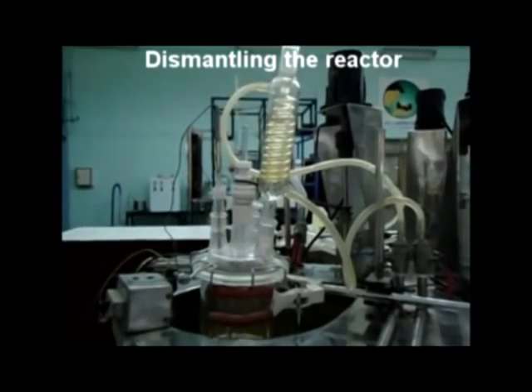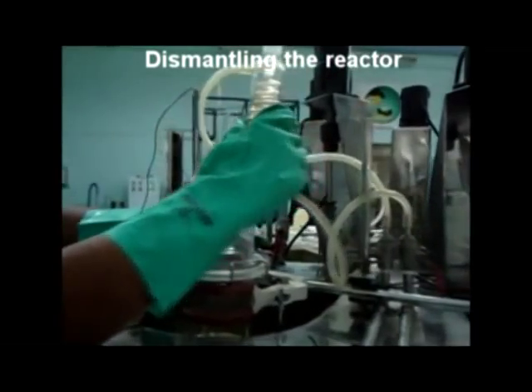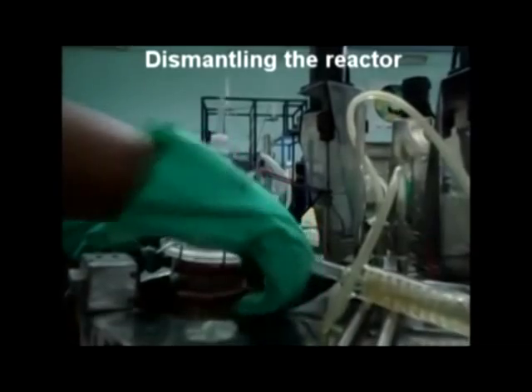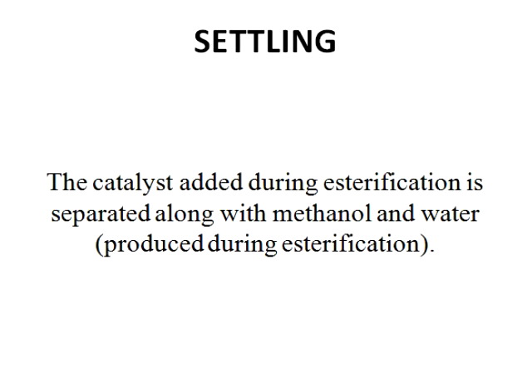After the esterification reaction is complete, dismantle the reactor by removing the condenser and the temperature sensor, loosening the clamp, removing the ring, and putting the reactor on the platform. Settling: the catalyst added during esterification is separated along with methanol and water produced during esterification.